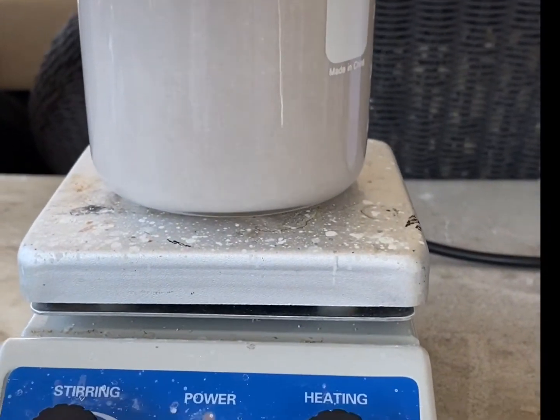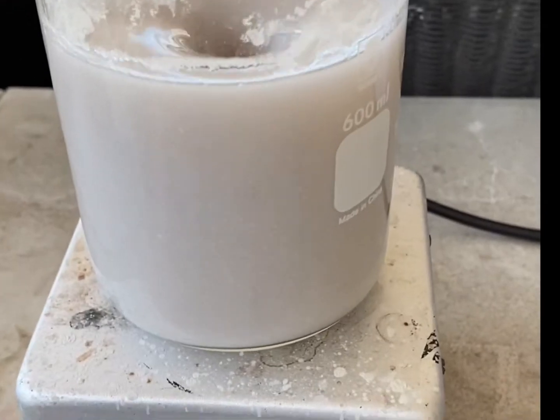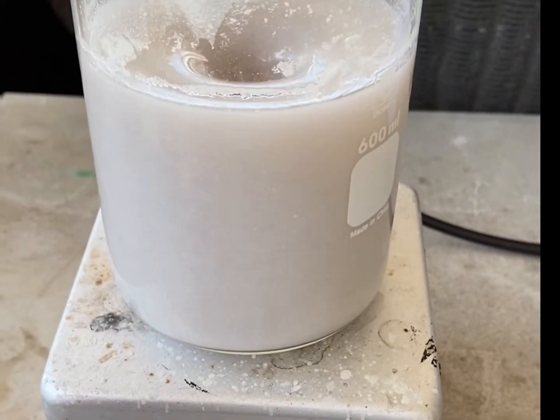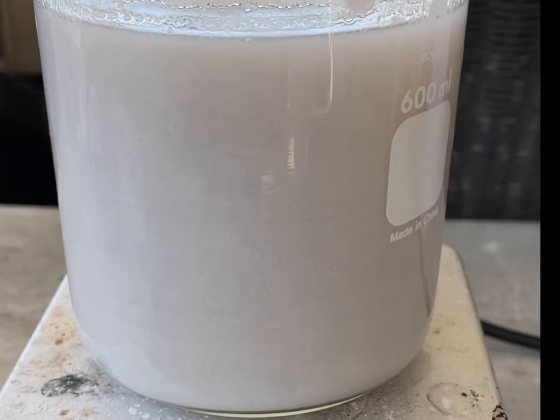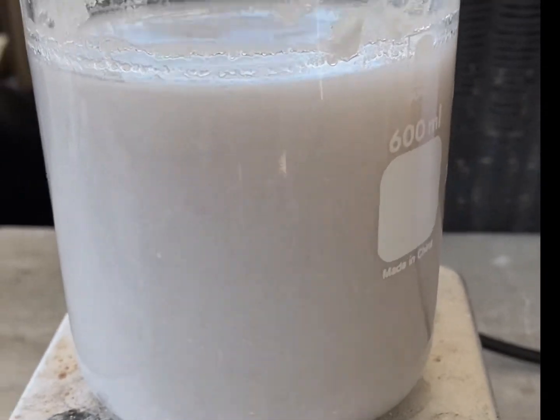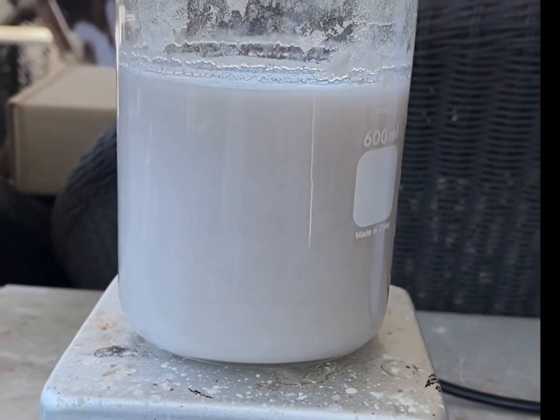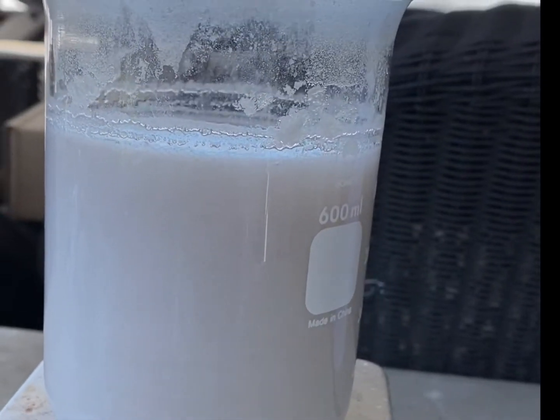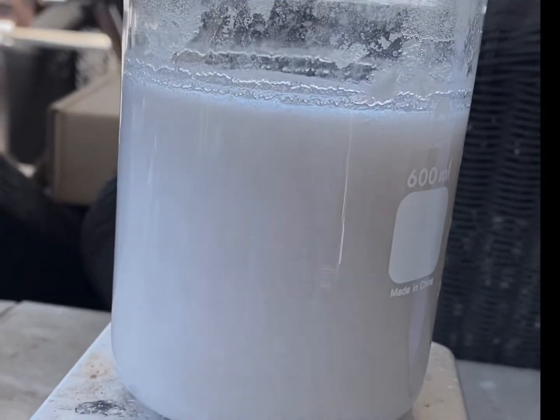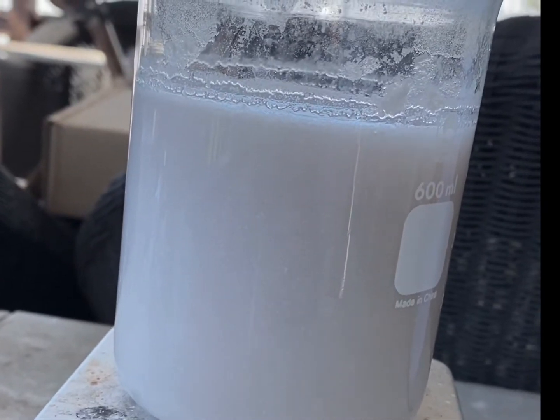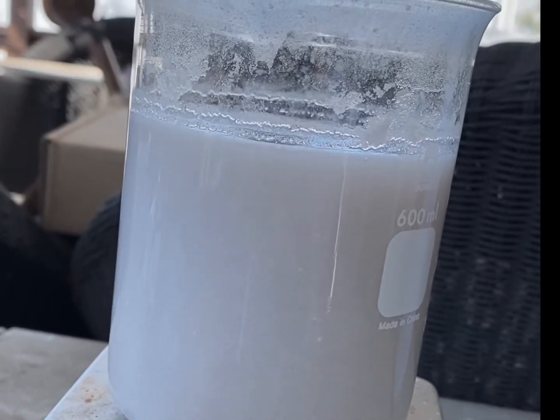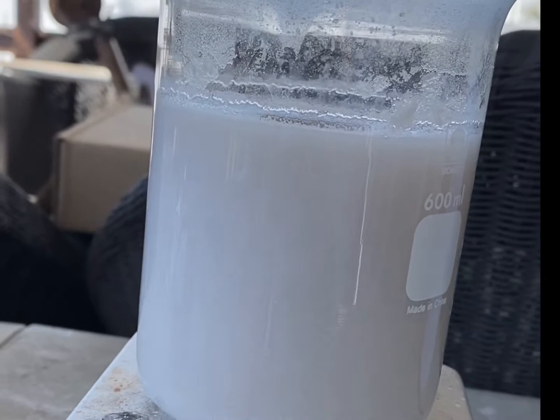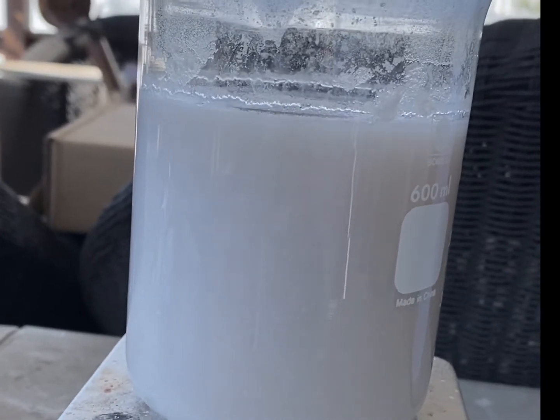So, I thought I saw an interesting property on this. It's kind of a murky solution. If you stop stirring it, as you can see, it's like particulate matter inside the solution, and it looks very wispy. I think it's undissolved sodium bicarbonate. And then, when you stir it again, it kind of looks like a snow globe. It's pretty cool.